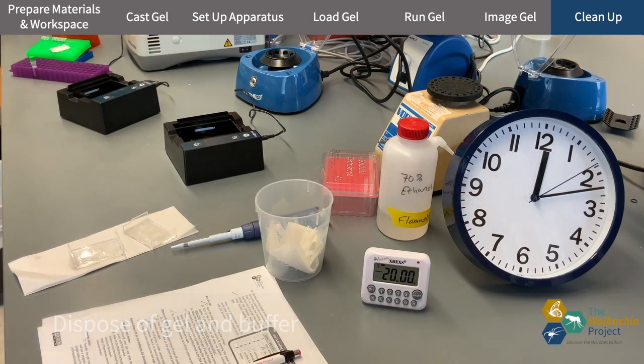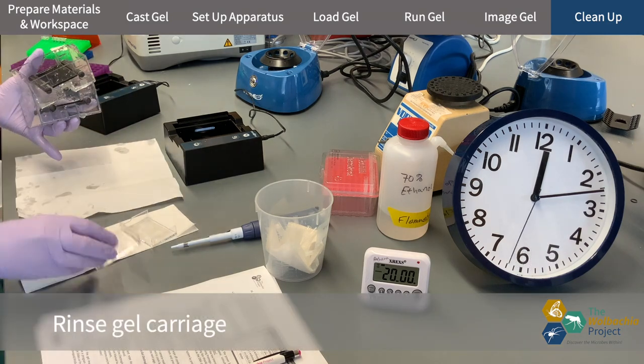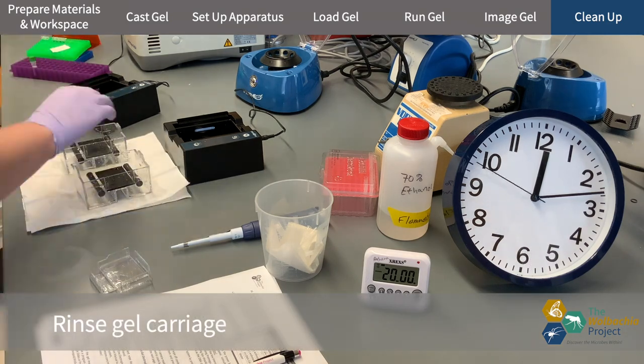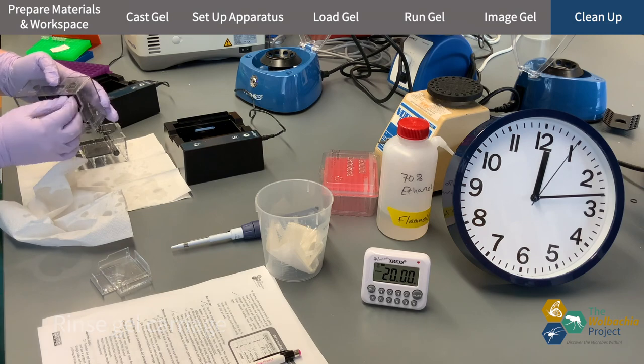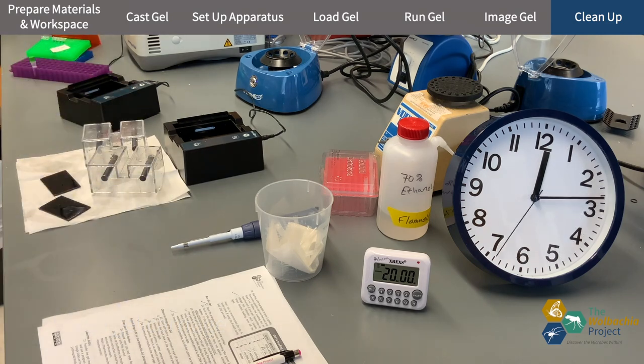Right now, I'm going over to the sink to dump out the buffer and rinse the buffer tank and the black viewing platform with DI water. Then I dry everything off and leave it to dry on a paper towel.